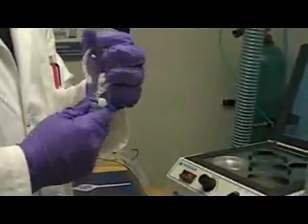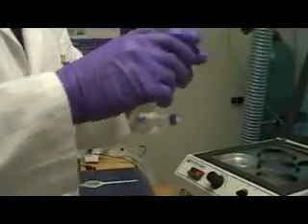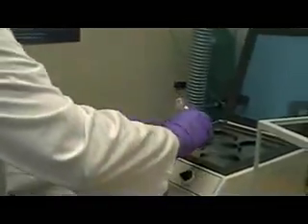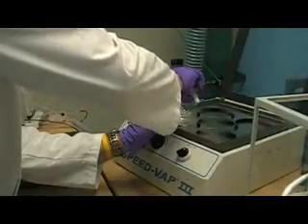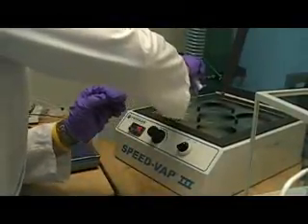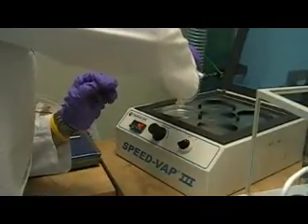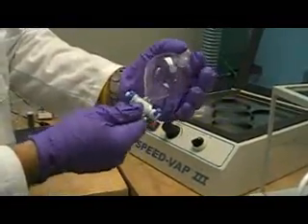And then the third rinse, which we call our rule of threes. If you rinse 3 times, you can get 99.999% of all the residue you would like to transfer into your transferred vessel. So I will do my third pour, removing all the hexane and leaving behind the residue on the vessel.